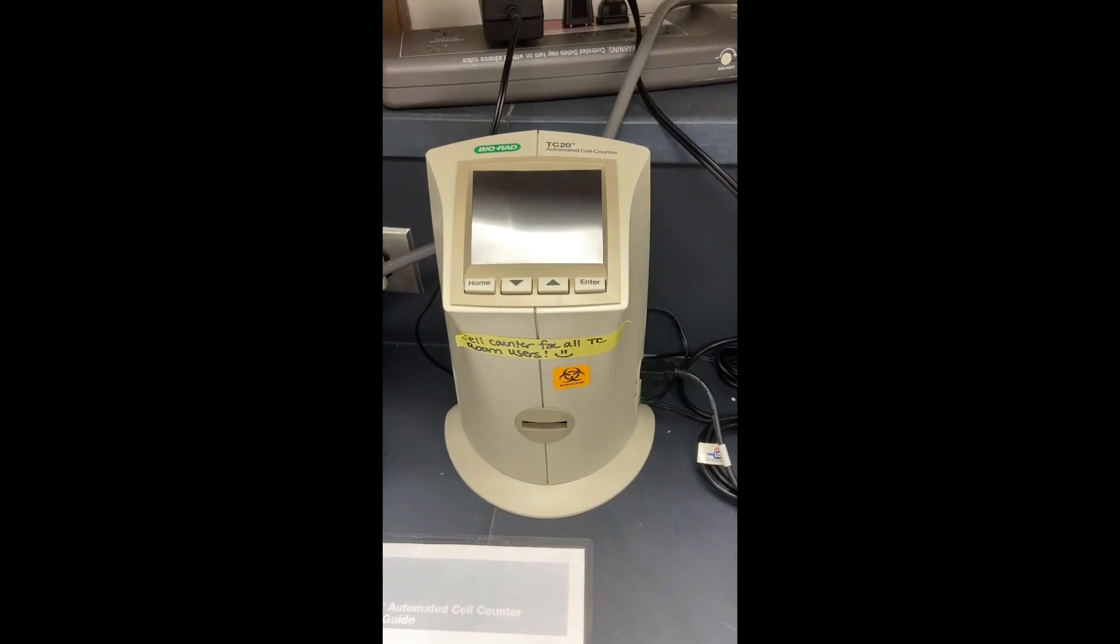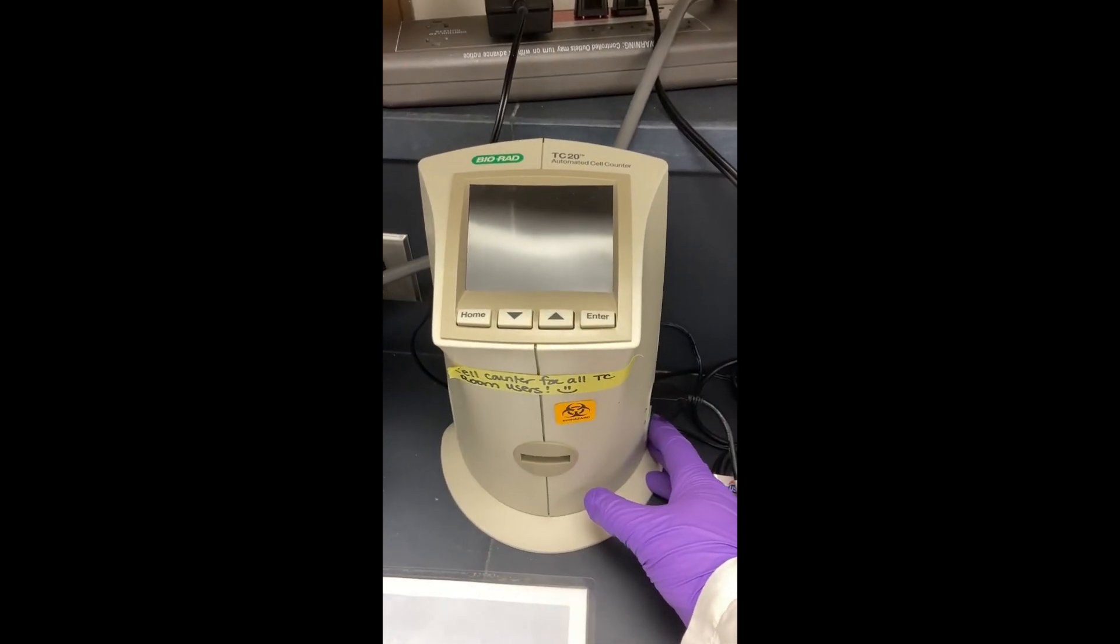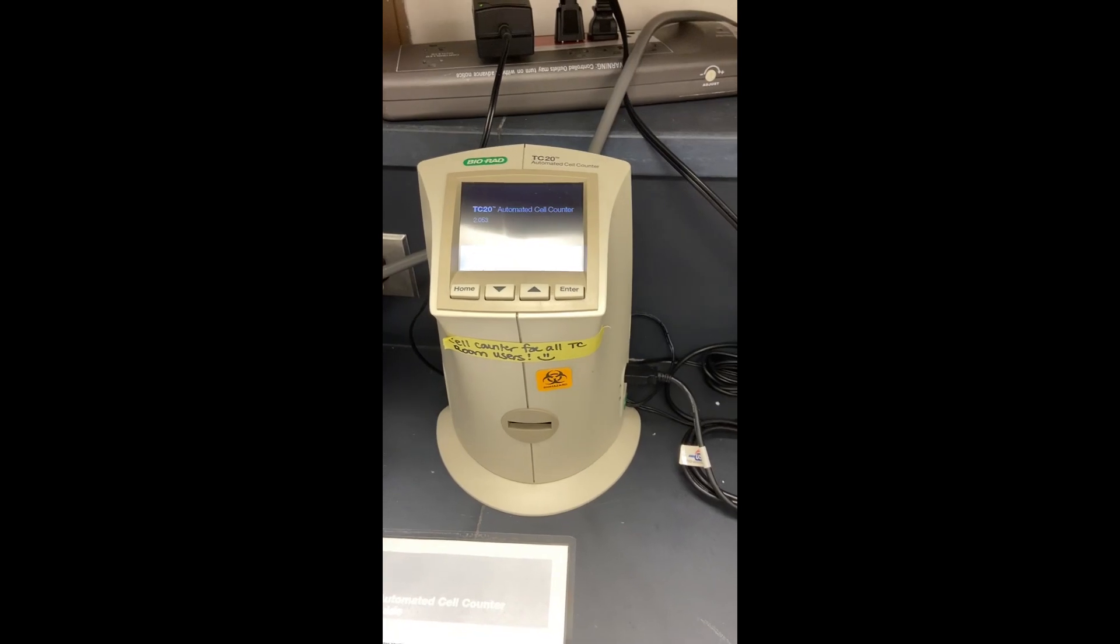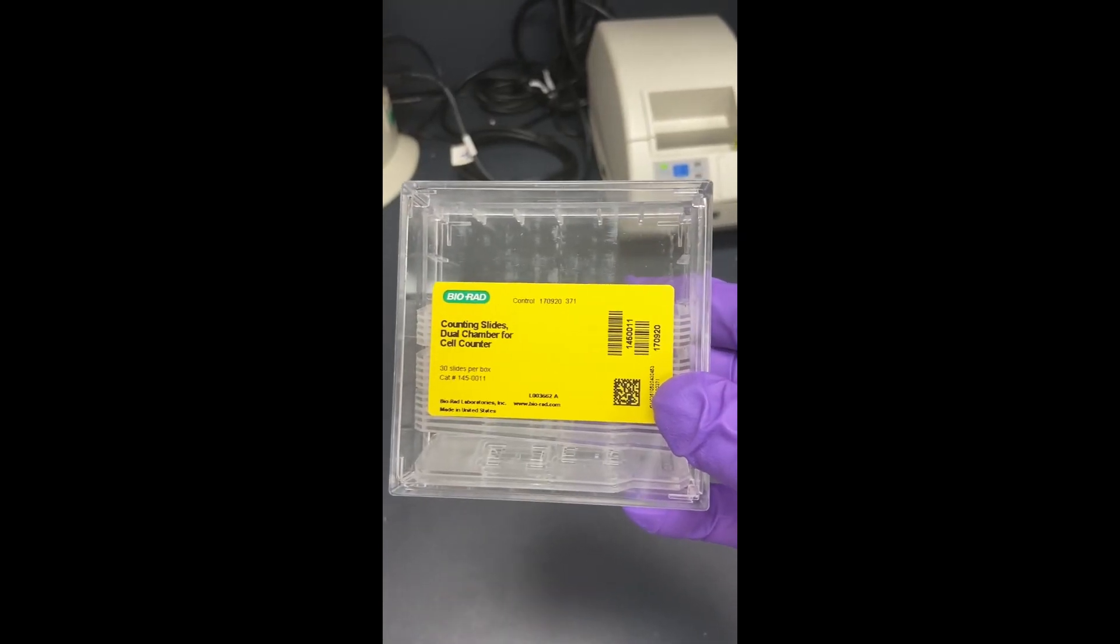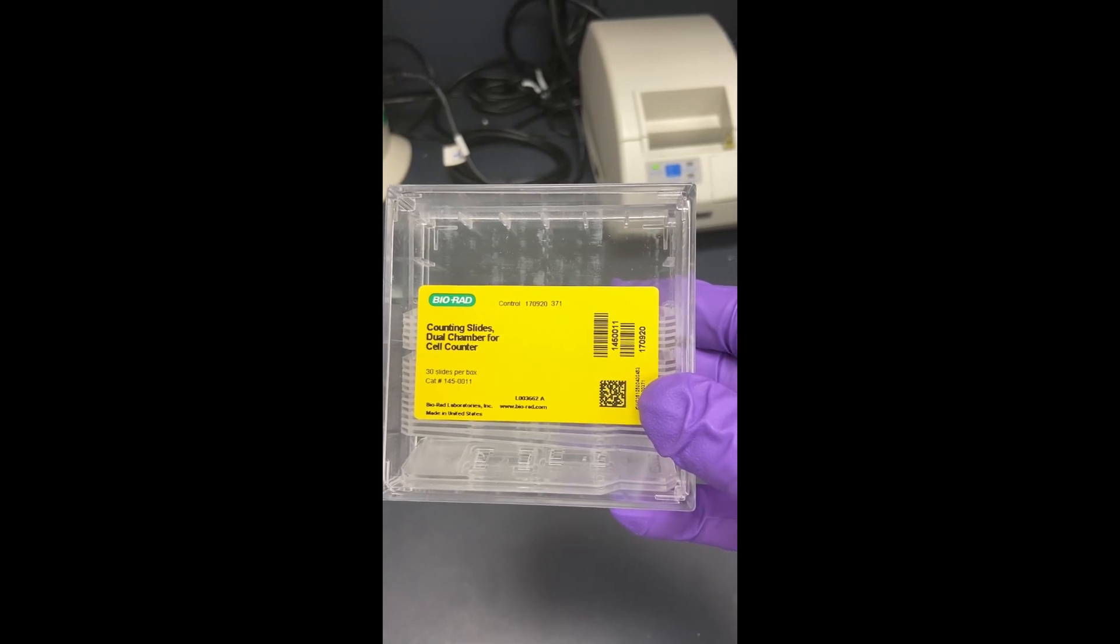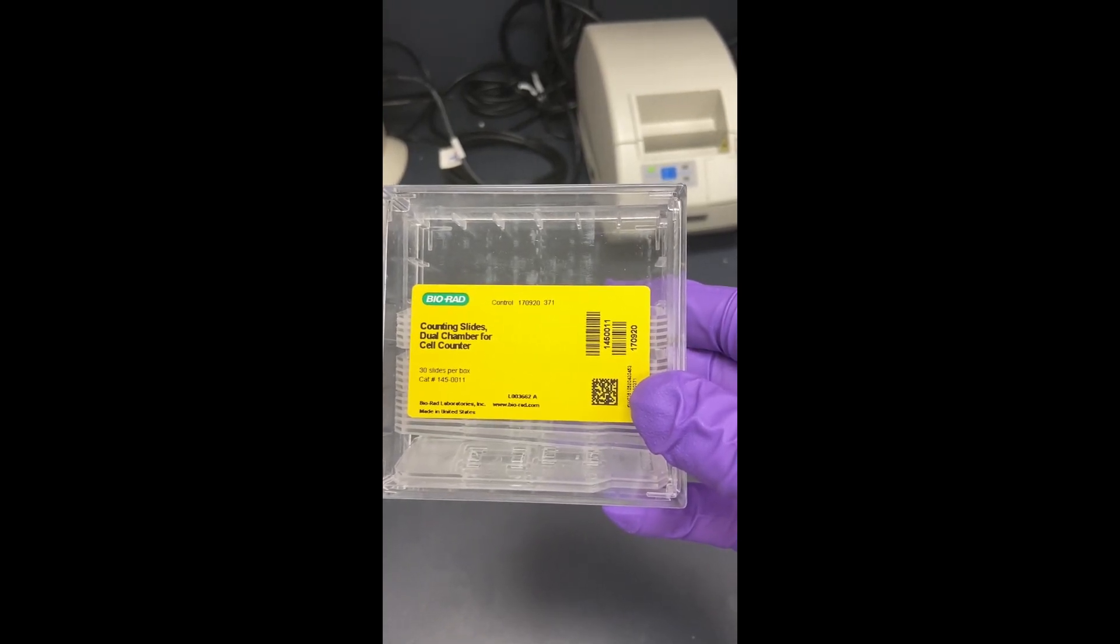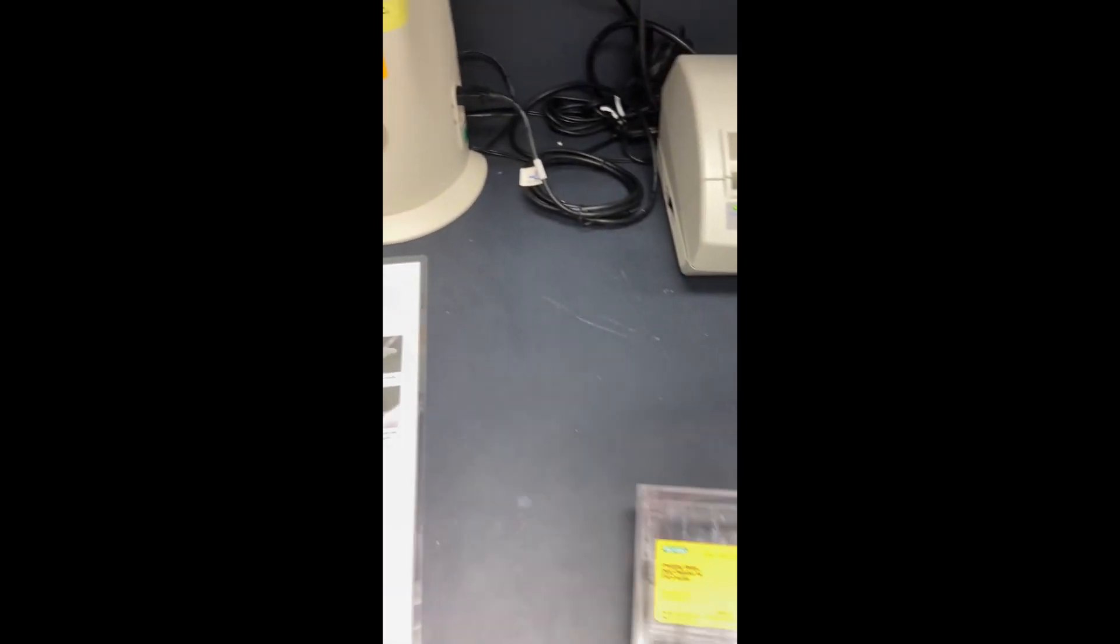So now what I'm going to be doing is turning on the cell counter and letting that warm up. In the meantime, these are the cell counting dual chamber slides for this particular cell counter.